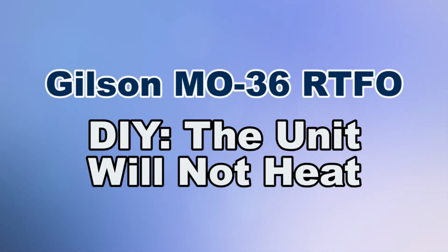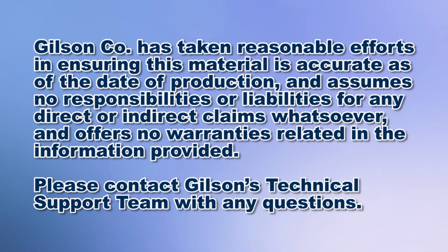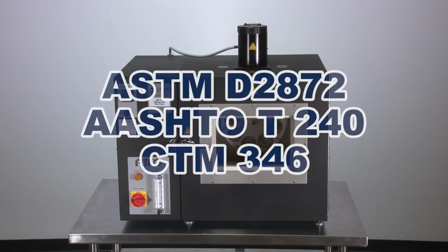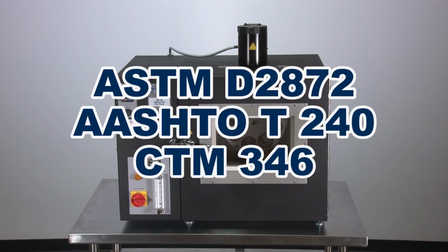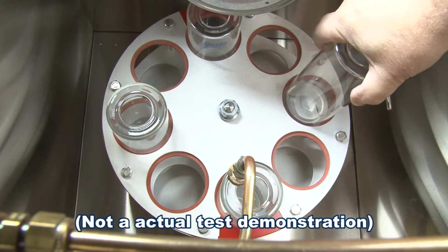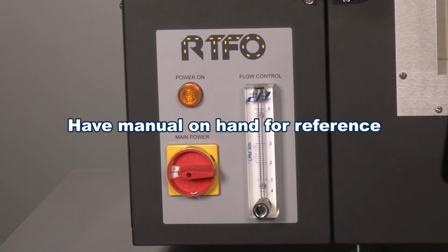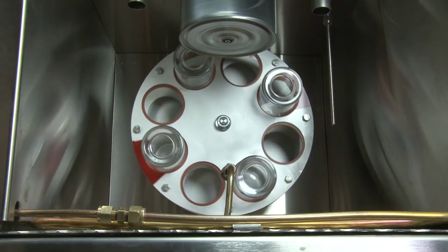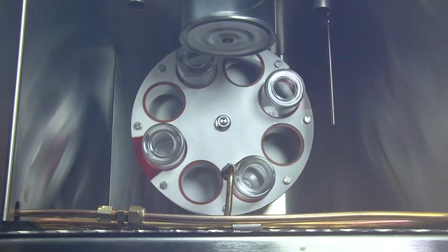The Gilson Rolling Thin Film Oven features advanced design, durable construction, and repeatable accuracy in measuring the effects of heat on asphalt binder specimens in accordance with ASTM and AASHTO test specifications. All Gilson RTFO ovens are completely checked and tested before shipment. Follow general installation instructions before beginning a test.